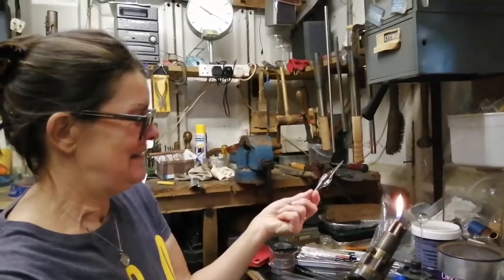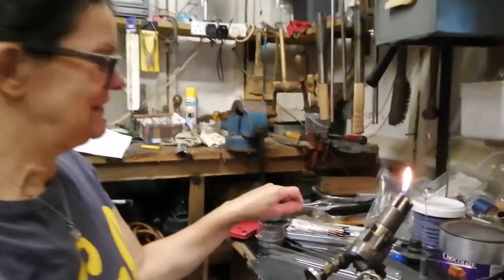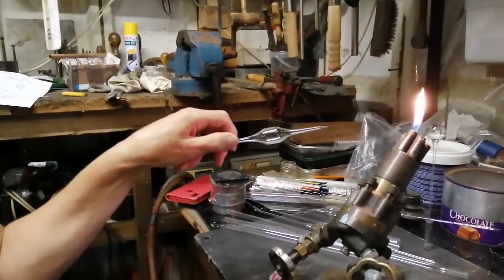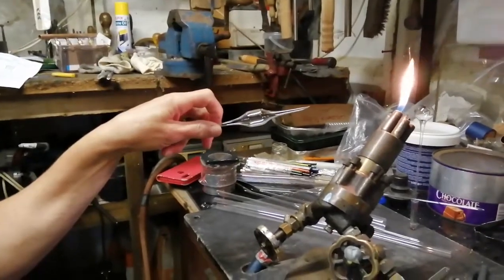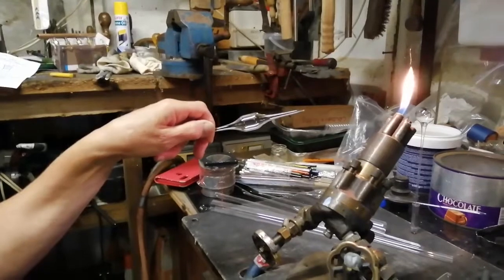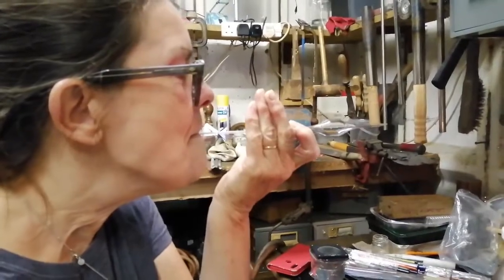So you're holding the glass with your palm facing down. Yeah. That's it. And you're pinching and turning, bringing my hand in close to show the flame. That's it. You pinch and turn, using the tips of your fingers. And you have to have a bit of glass through the back of your hand. So if you'd like to try the practice blow, please, you bring it up like so.